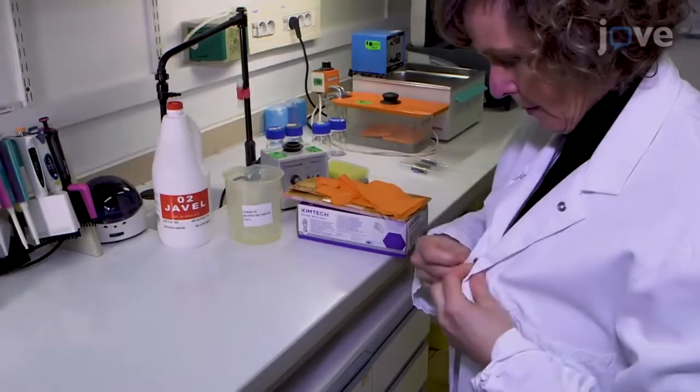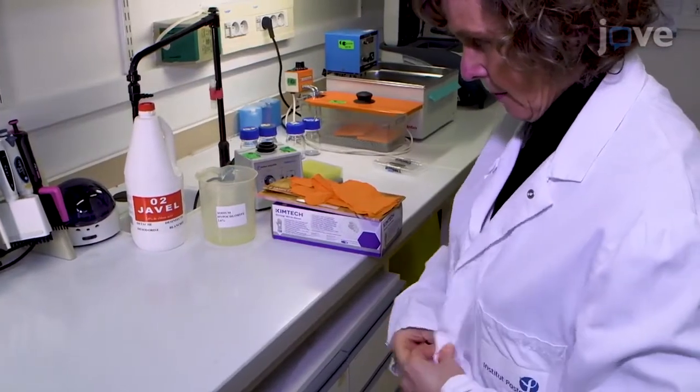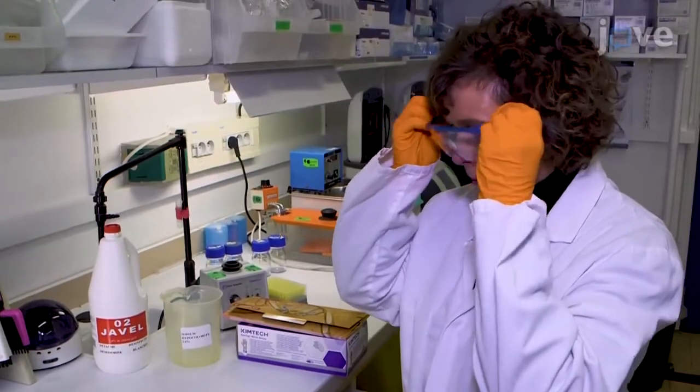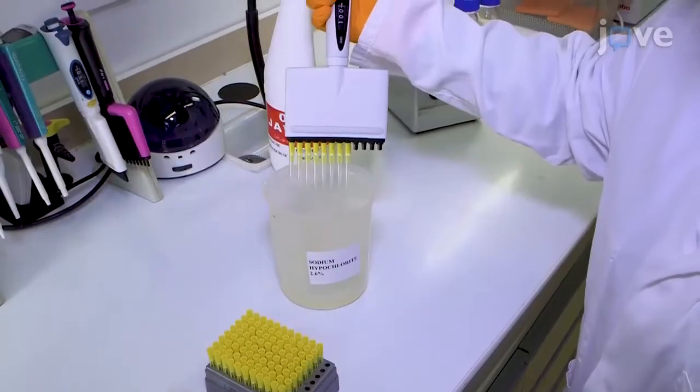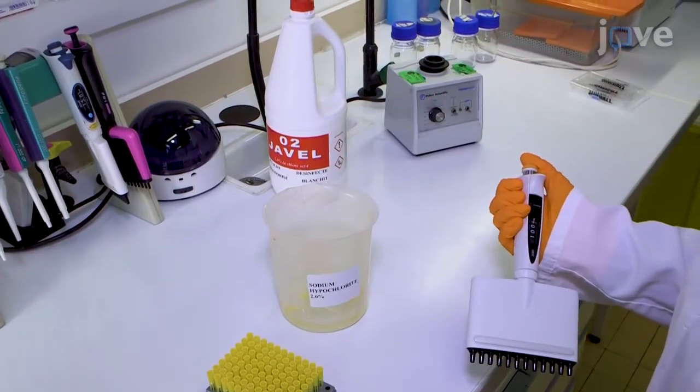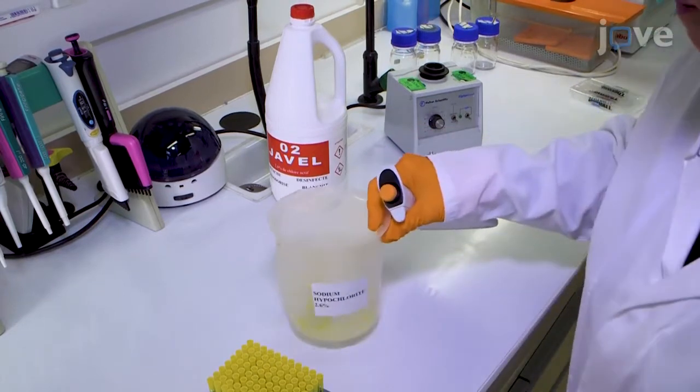To begin this procedure, put on adequate personal protection equipment, including disposable coat, gloves, mask and glasses. Treat the contaminated materials by immersing it in a solution of 2.6% sodium hypochlorite for 30 minutes for decontamination.